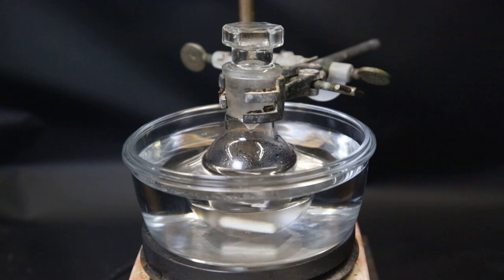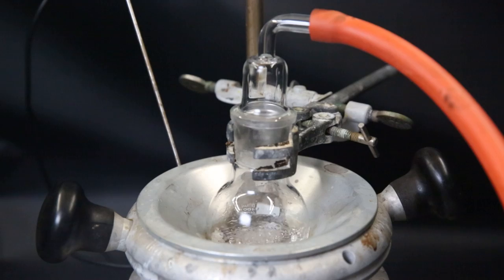When I come back, all the ice is gone and the reaction should be finished. Now I will boil off all of the acetone. So I set the flask in a heating mantle and attach the gas adapter and heat it to 30°C. I pull a vacuum and simply let the acetone go through the pump.